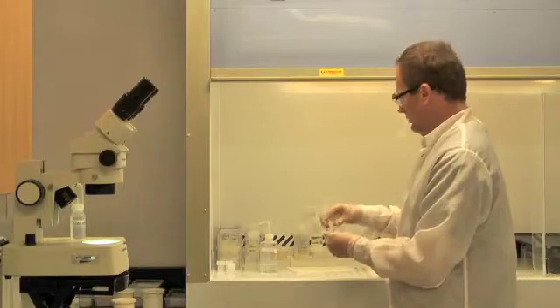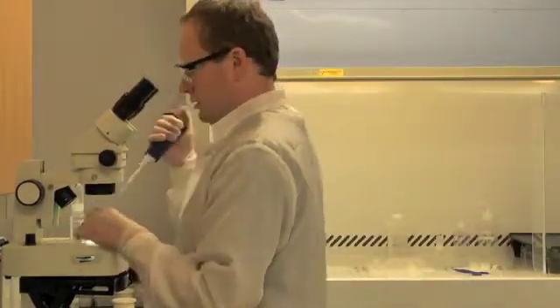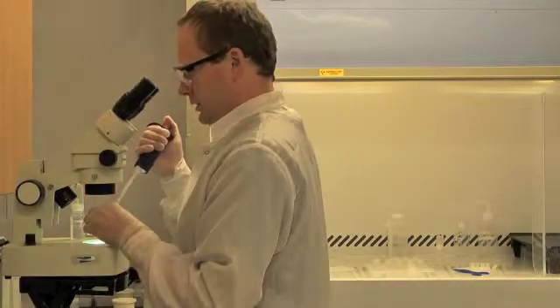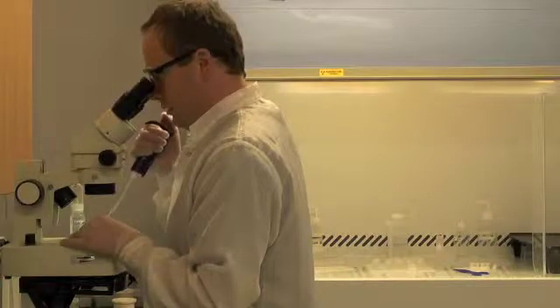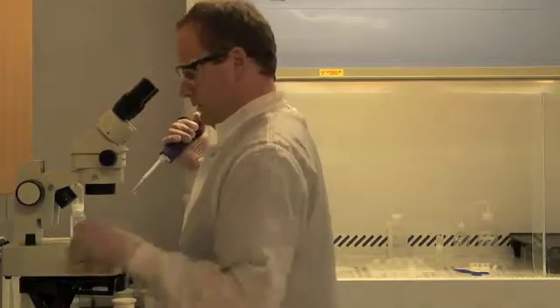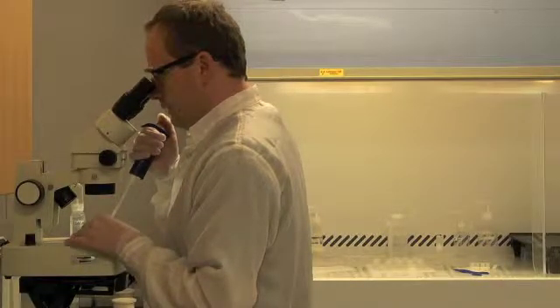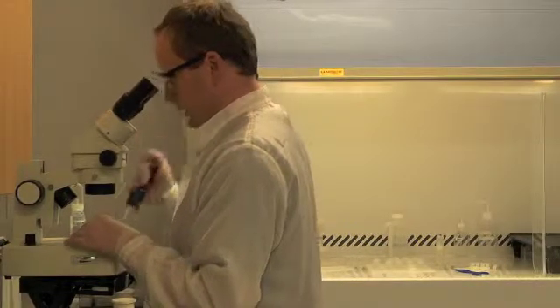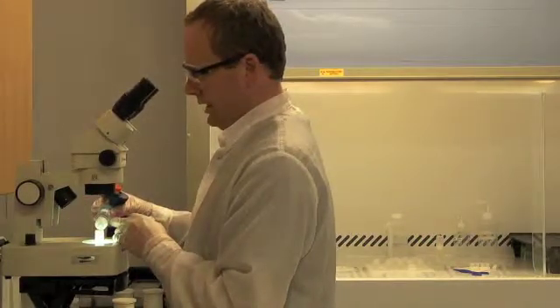I'm ready to do the final rinsing of the zircon. This is similar to the rinse that I've given them before. Picking up the grain in my pipette, discarding the liquid, putting the grain back in the beaker, pulling most of the liquid off, and then putting fresh nitric acid in.